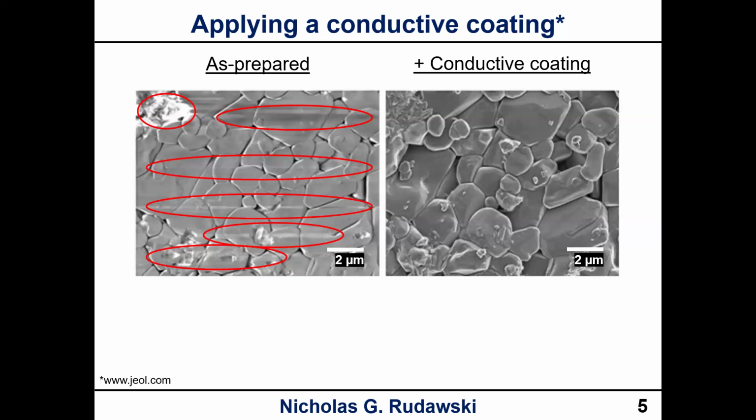Because you see these streaks all over your picture and it makes it hard to see the actual sample itself, okay? You can also have a supersaturation of signal or signal clipping, like what we see up here in the upper left corner, okay? So this is another hallmark of charging, where you have difficulty getting proper optimization of your detector, because you're usually dealing with some areas that get super saturated with the signal, and it's hard to adjust your gain and your brightness and contrast, I should say, to get rid of those, okay? But if we look at what happens when we add a coating, all of this goes away. And actually we can see also, in the uncoated sample, it looks kind of flat, right? But if we look at the sample with the coating, we see additional depth perception that we weren't seeing with the sample on the left, right?